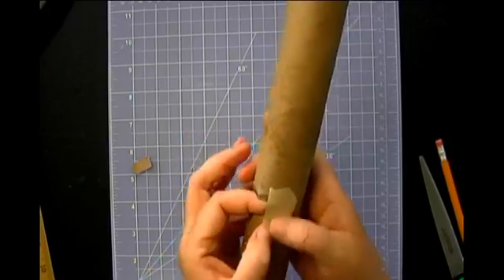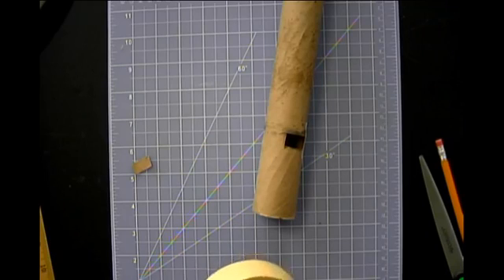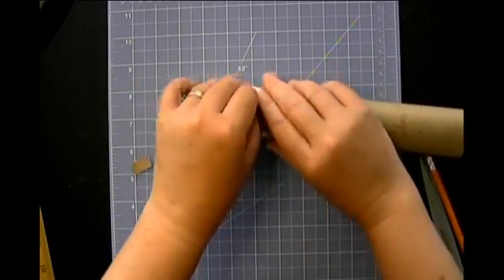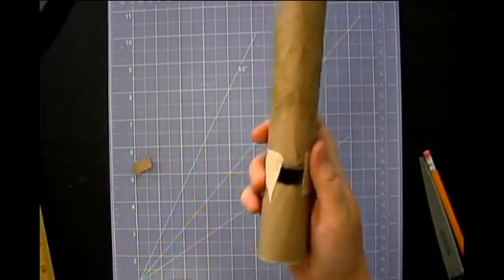Now, at this point, you may decide that you want to decorate your spectrometer, and I absolutely encourage that you do that. So you can get out some star stickers, you can get out some paint or construction paper, and really make it look super cool at this point, because this is a great chance to show how much you love science. Okay, so there we go. I cleaned that up just a little bit.